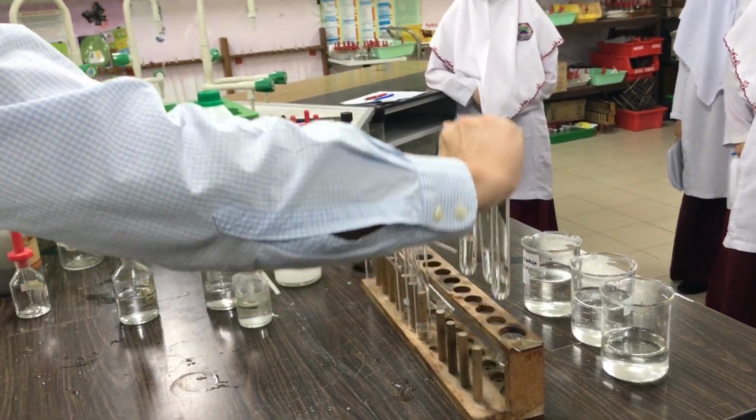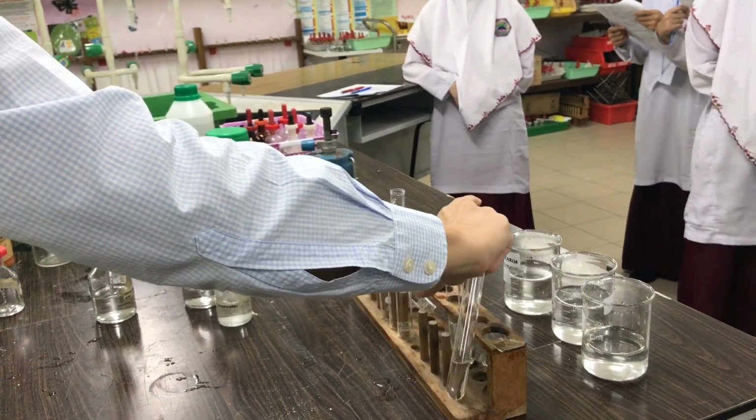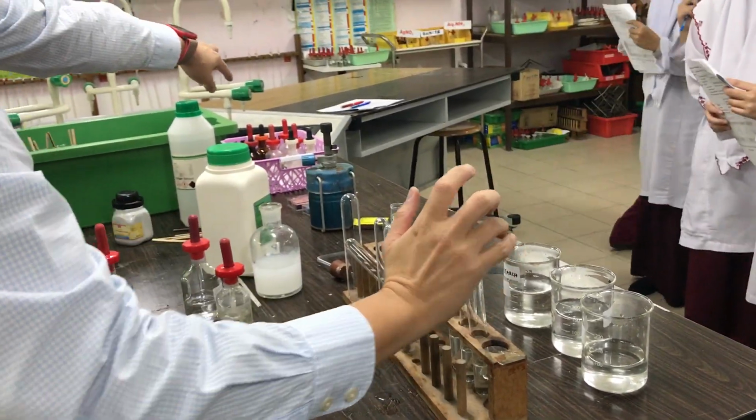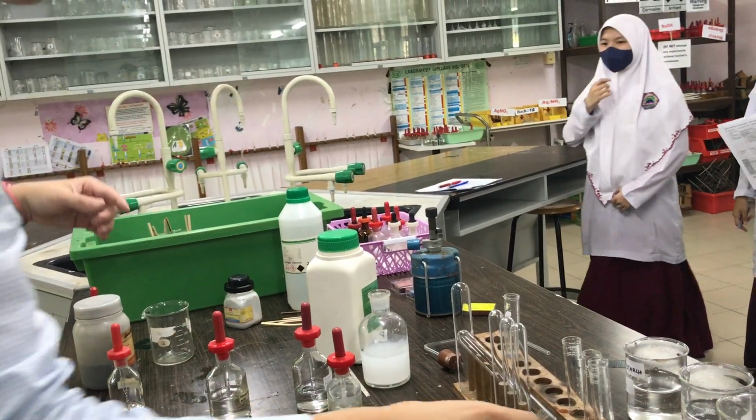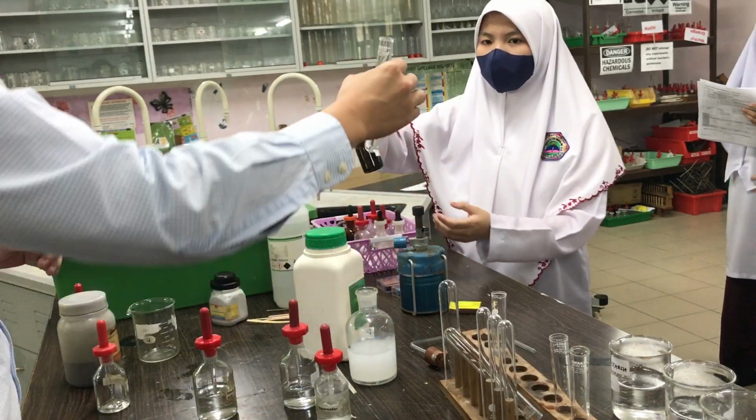After you add nitric acid, what do you add? Okay, find for me silver nitrate. You got silver nitrate? Okay, go on, do it.